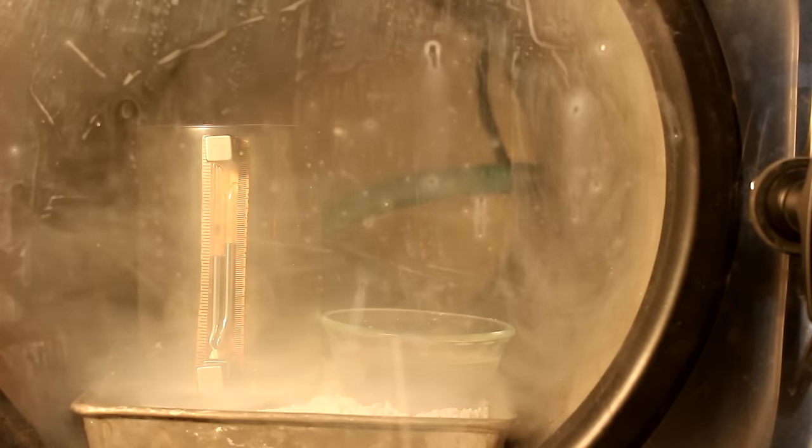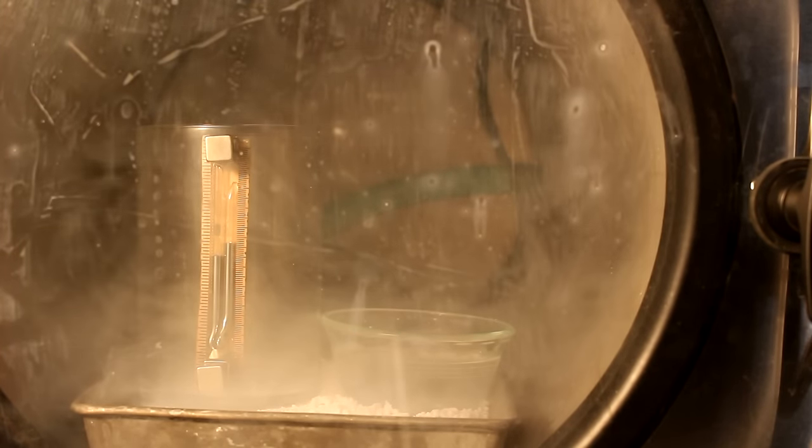Well, that threw potassium everywhere. Didn't really change the pressure much. I didn't really see it change it at all, in fact. Let's look at that.